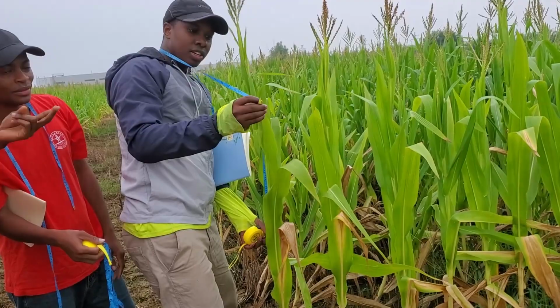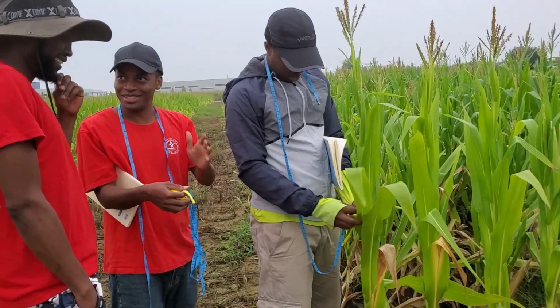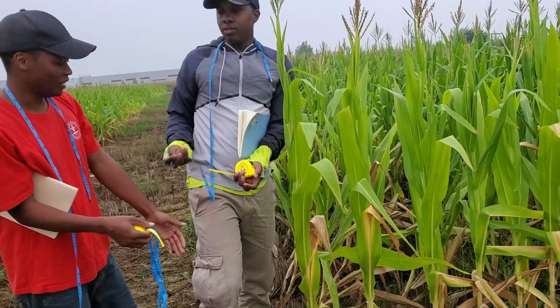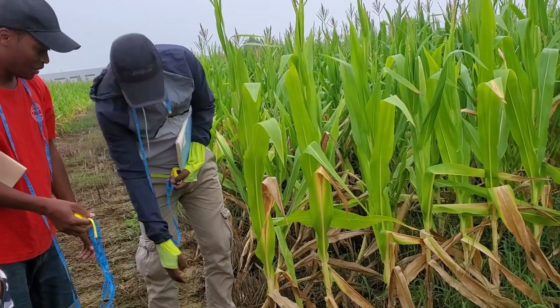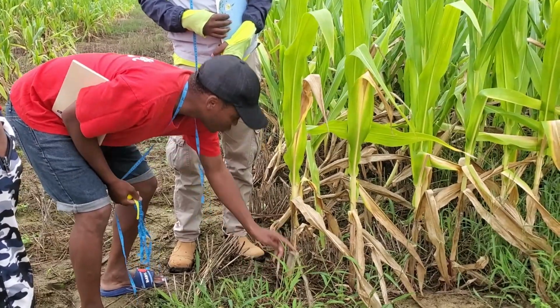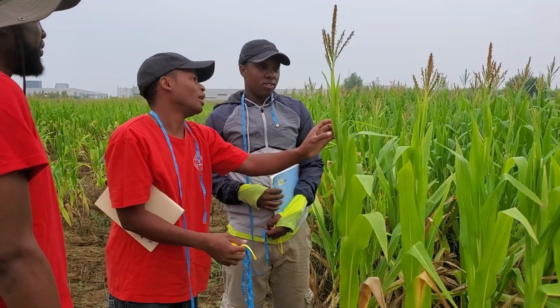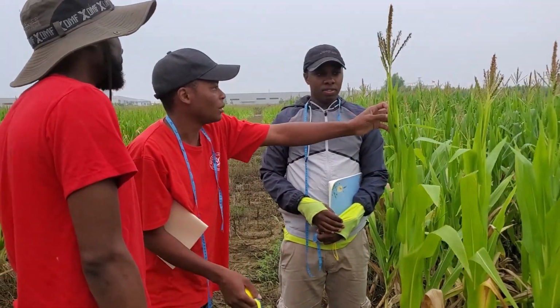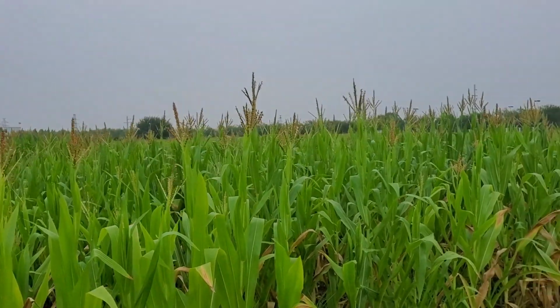Leaf area, only 3 leaves? Yeah. If I measure all of the leaves like we did there, I think we would measure for 1 week. Then how many leaves do you count? Open leaves. Like this is the first one: 1, 2, 3, 4, 5, 6, 7, 8, 9, 10, 11, 12, 13, 14, 15, 16. This small thing, you don't count this? It's a leaf. It's a tip.